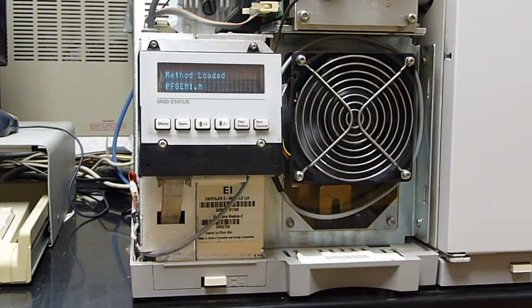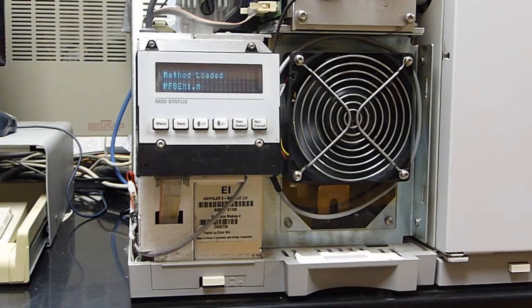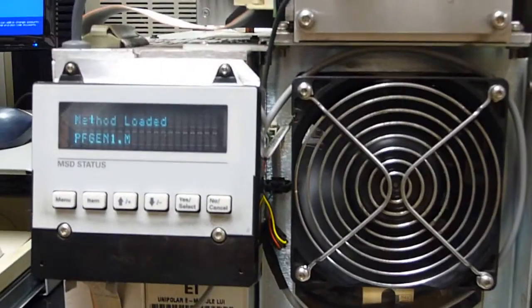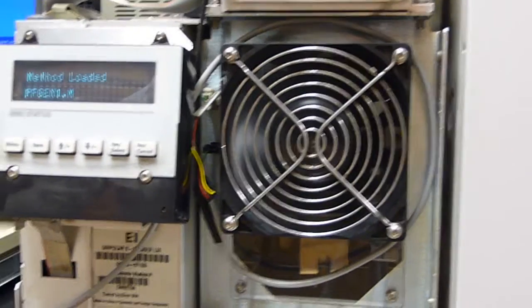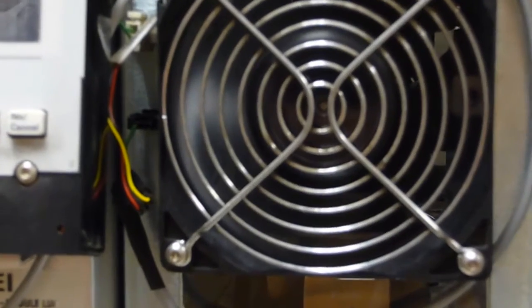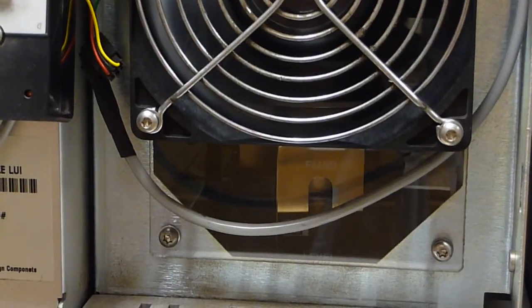And the beauty of a diffusion pump is, supposedly, it can pump without any moving mechanical parts. Now, in order to cool a diffusion pump, it's either going to be air-cooled or water-cooled. Langmuir in the early days used water cooling, right? But nowadays it does have one moving mechanical part. It has a fan.